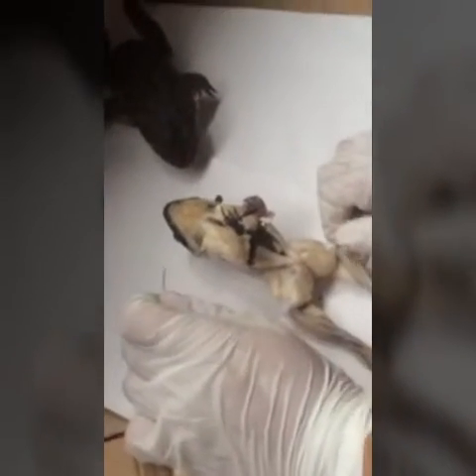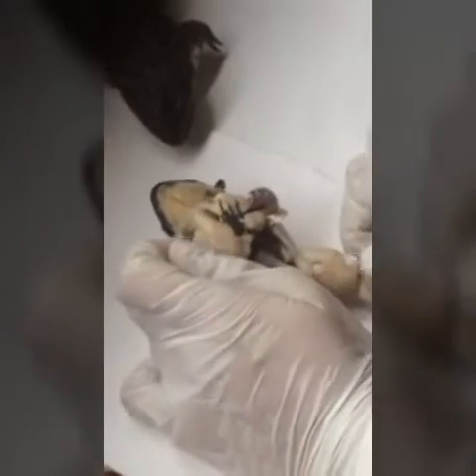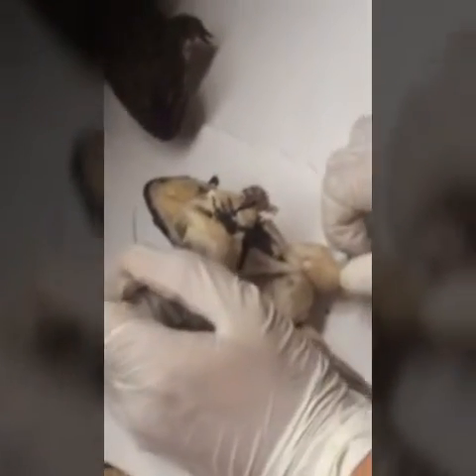The first part is the submentalis, which is located over here. Then we have the geniohyoid, which is over here. But if you cut it out, you'll see the mylohyoid, which is apparently inside it, but we're not able to cut it.